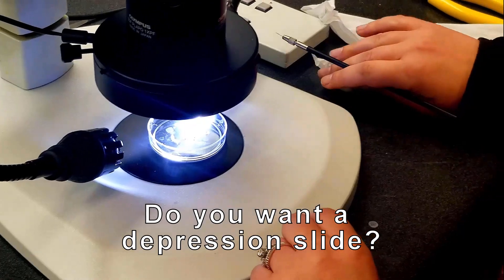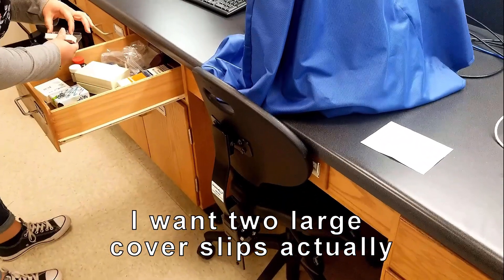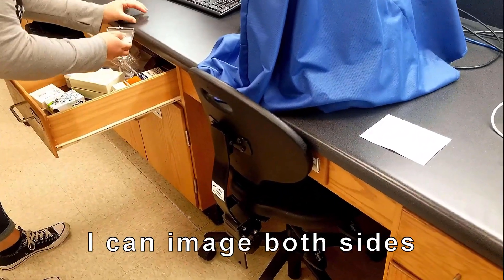Do you want a depression slide? No, I want two large coverslips actually, so that if I put it the wrong way up, I can image both sides.